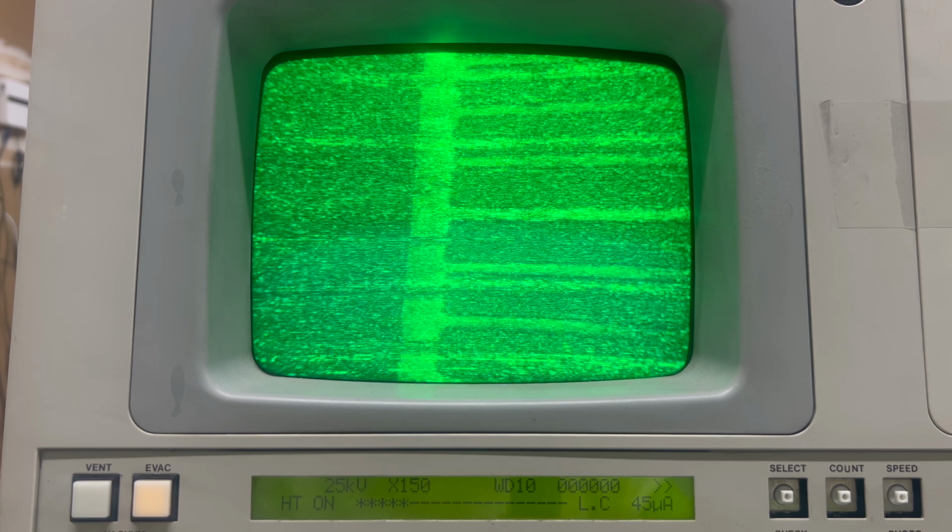Most of the high-quality images taken by electron microscopes are done using an extremely slow scan mode, often around 1 minute per image to extract the maximum detail. Speaking of detail, I was curious to determine the maximum resolution of this microscope. To do that, I needed to find something with an extremely small feature size.